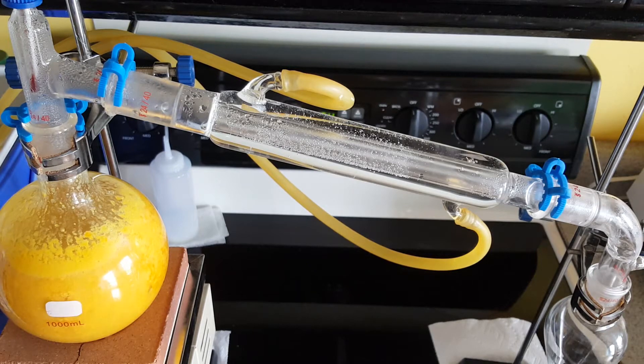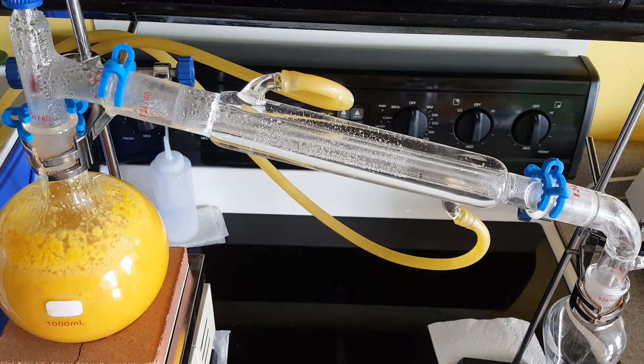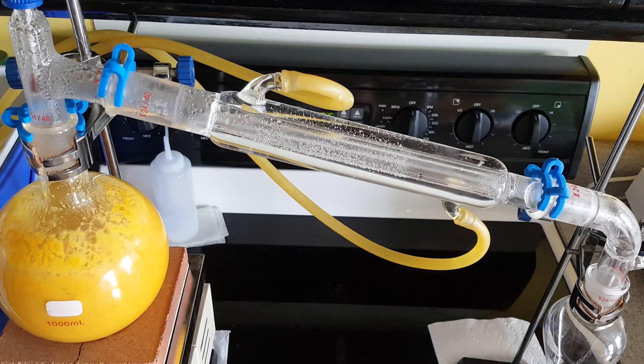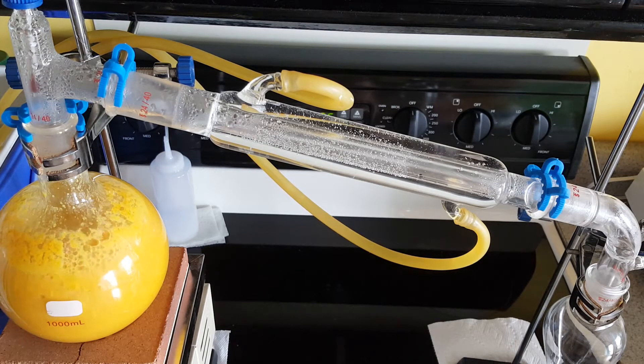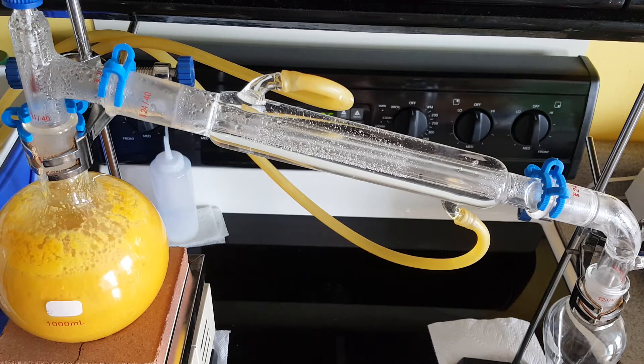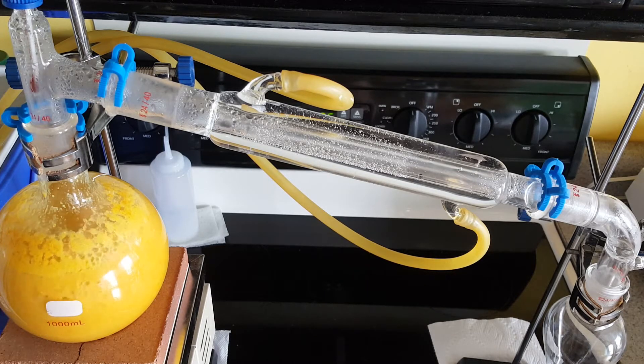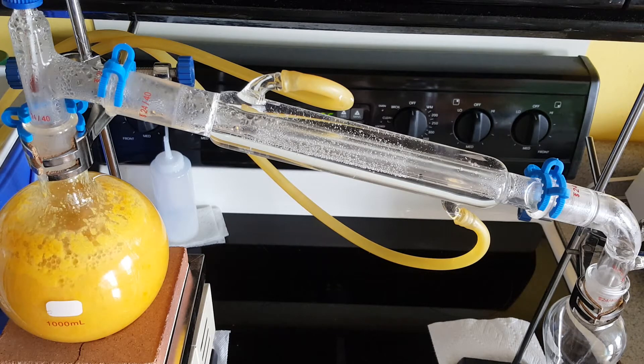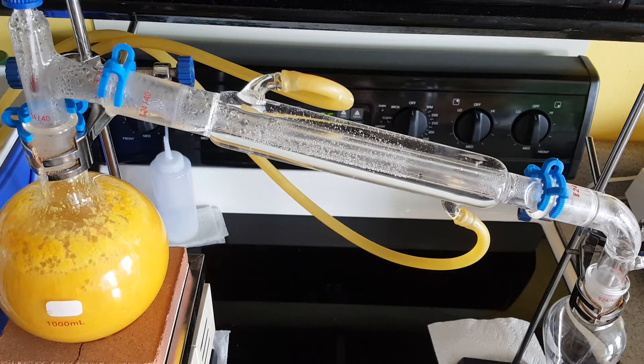I'm almost at 80 degrees and somewhere between 80 and 100 is when I had my process distill yesterday. I'm at around 98 degrees in the neck and I see first droplet dripping down. Apparently this particular oil evaporates very close to the water's boiling temperature, so unlike the grapefruit oil which evaporated around 80 something degrees, this one actually needs to be close to 100 degrees.